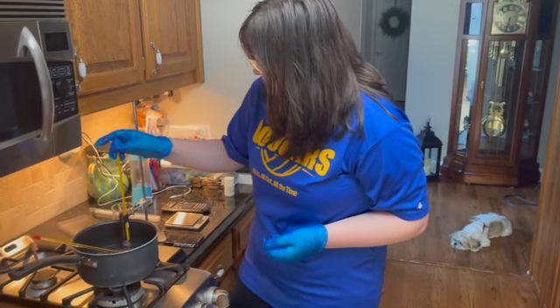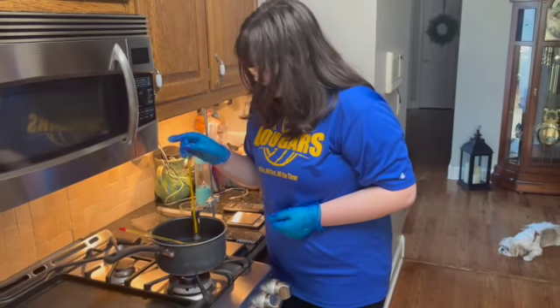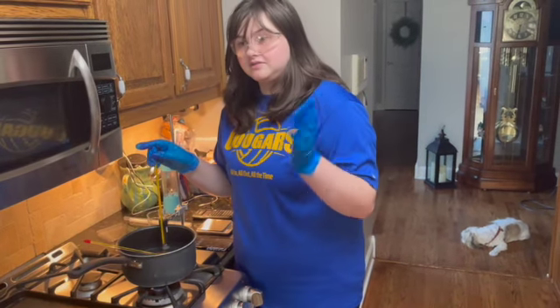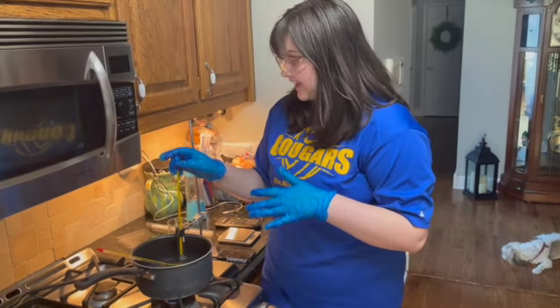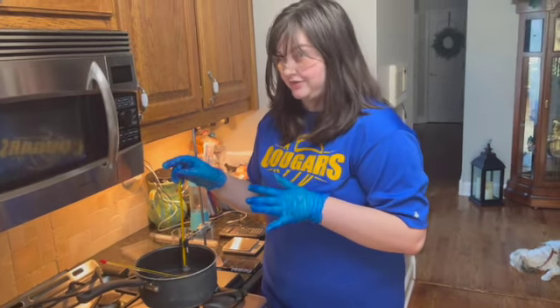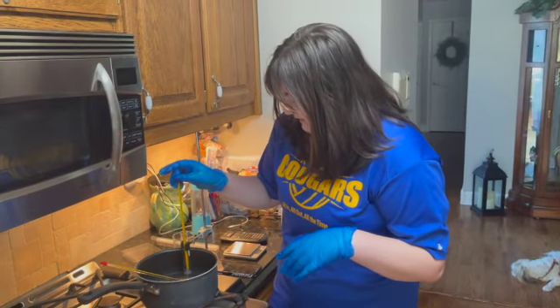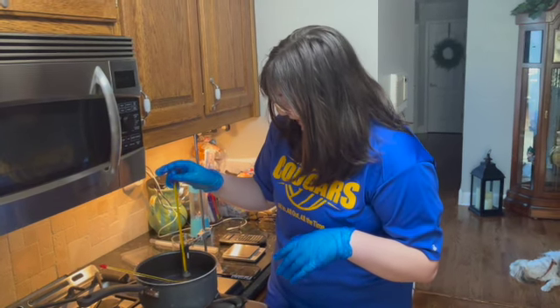So yeah, right now its texture is looking a lot more slushy-like than it did before. At the first part of it, it still looked like there was solid mixed with a little bit of liquid, almost like if you leave crushed ice out for just a few minutes. But now it looks exactly like you would get for a slushie at a movie theater. And in observation, it is a cloudy white.